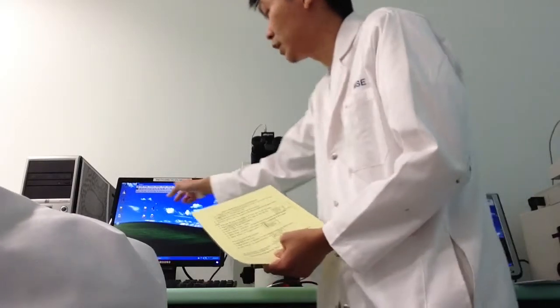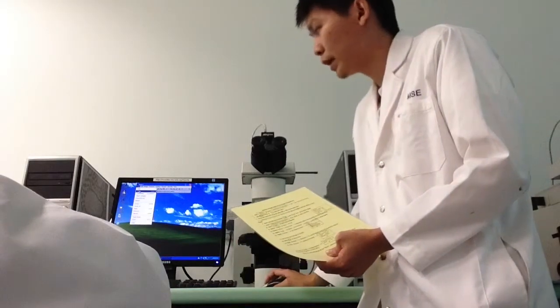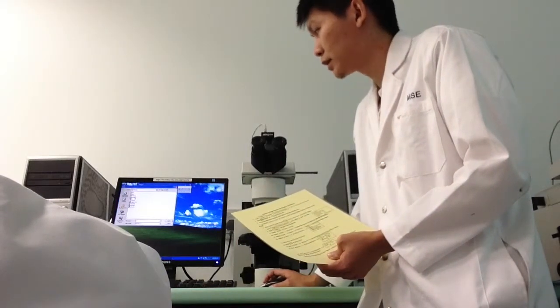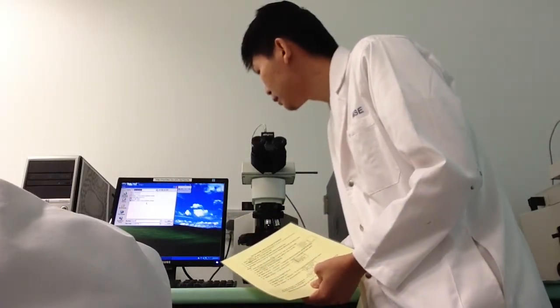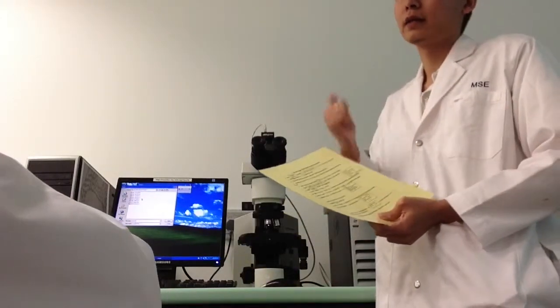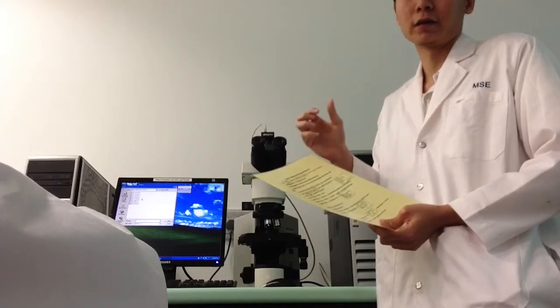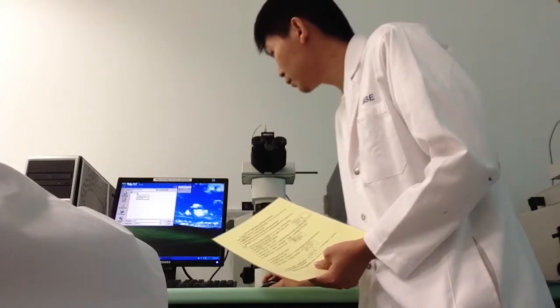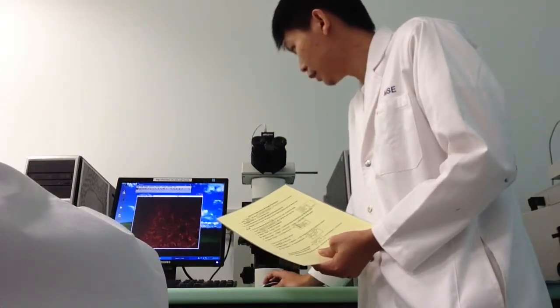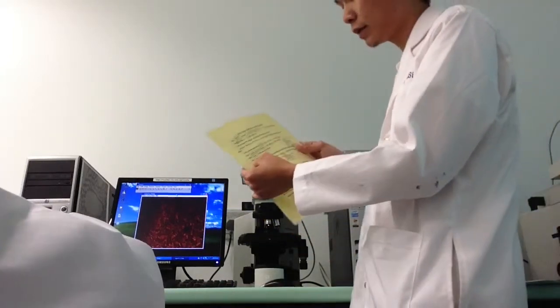You should see something like this. The first thing you should do is to open up the image that you have just saved. Go to D drive again. ImageJ is to measure, to analyze and also calculate your image, the different sizes and all. So you just go back to your same folder and open this image. We are now at step number 9.